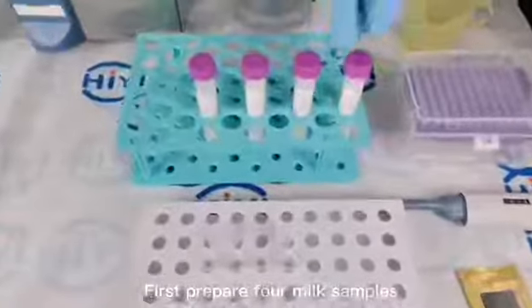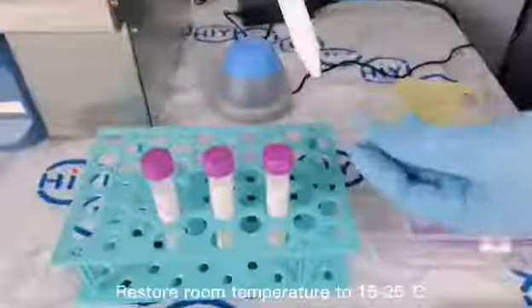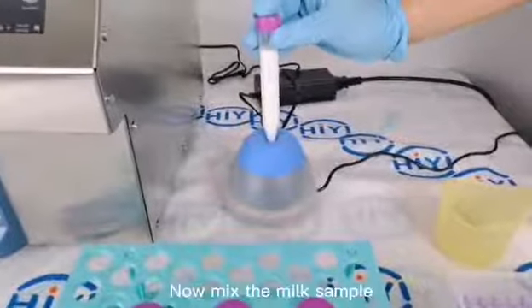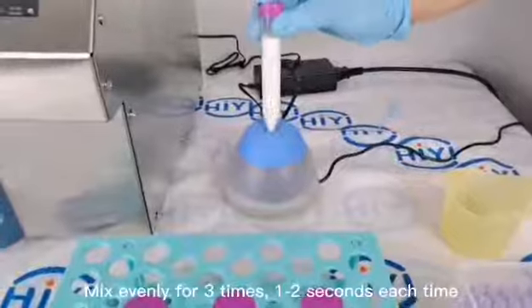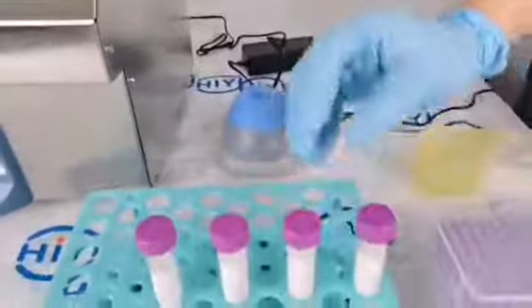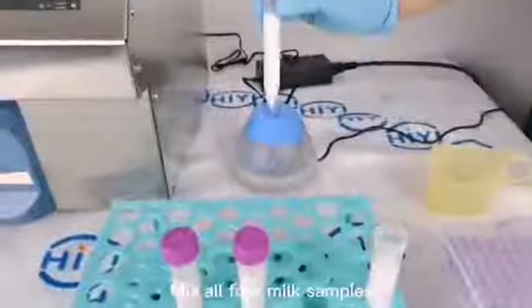First prepare four milk samples. Restore to room temperature, 15 to 25 degrees. Now mix the milk sample. Mix evenly for three times, one to two seconds each time. Mix all four milk samples.